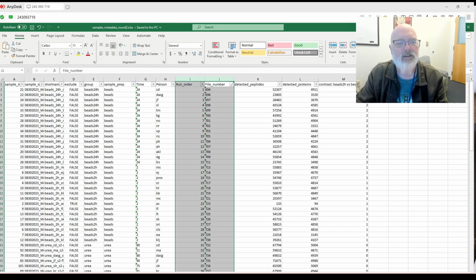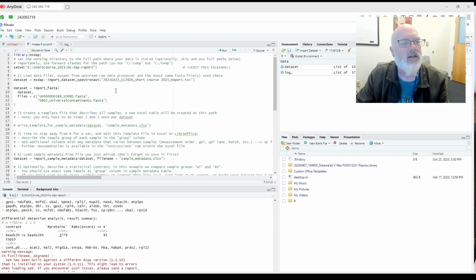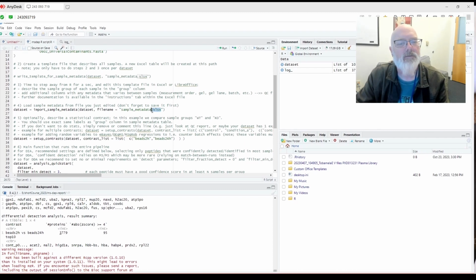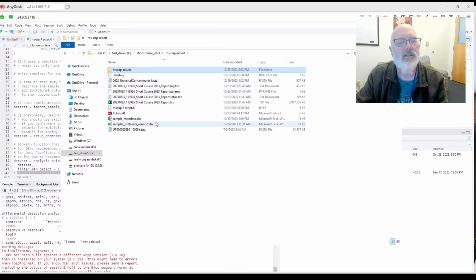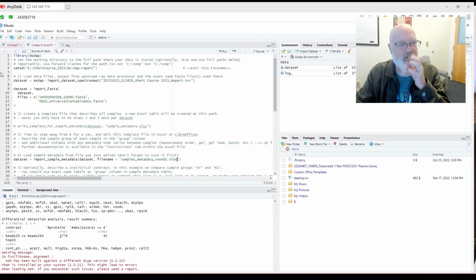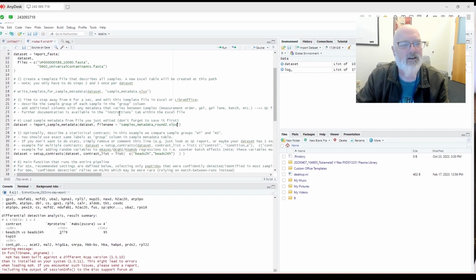So let's close that and close that. And let's change our script a little bit. The first thing we're going to do, we already have the data set imported. And instead of sample metadata, we're going to use sample metadata round 2, and it will probably fill it in for you. If you hit tab, it'll fill it in because the working directory is already set. That's a little RStudio trick. I don't know if it does that for R.